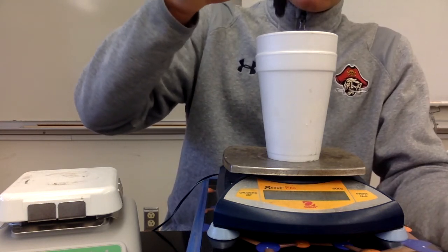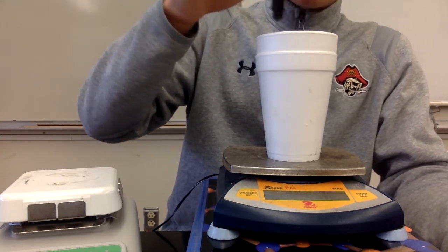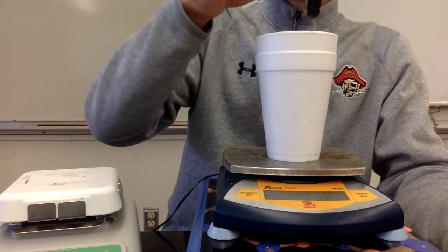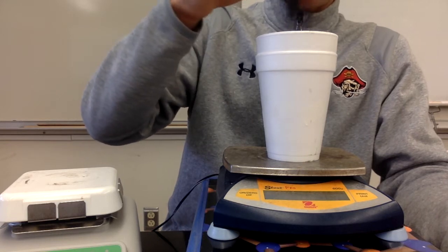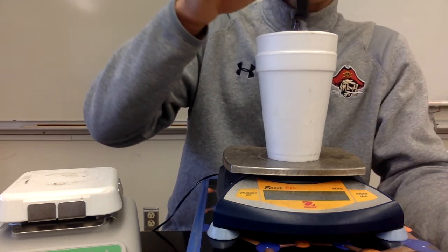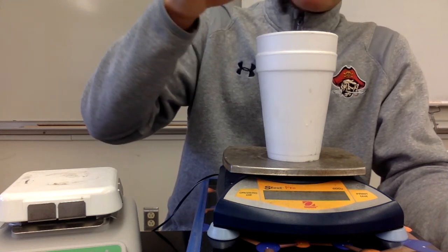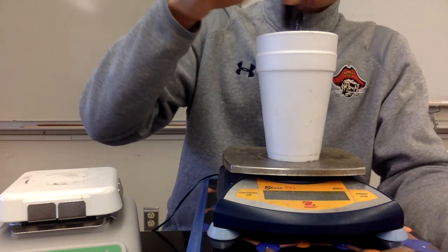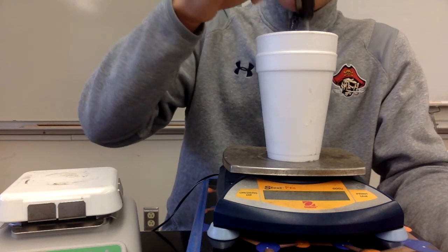And we want to get this as close to 0 as possible because then that makes the calculations easier. Then basically, however much the temperature of the hot water has changed, you'll take that temperature change times the mass of the hot water, and then times the specific heat of water, which is 4.18 joules per gram degree Celsius. When you multiply all that together, you'll figure out how much energy that hot water lost, and that's going to be equal to the amount of energy gained by the ice cubes. And that was required to melt the ice cubes.